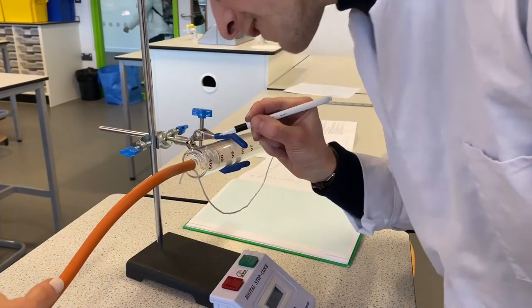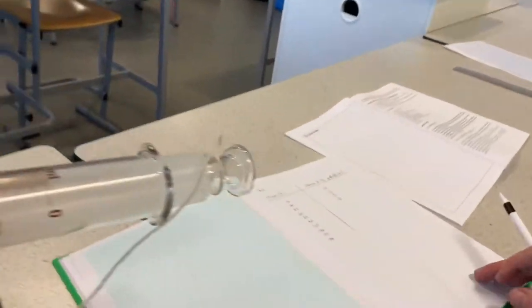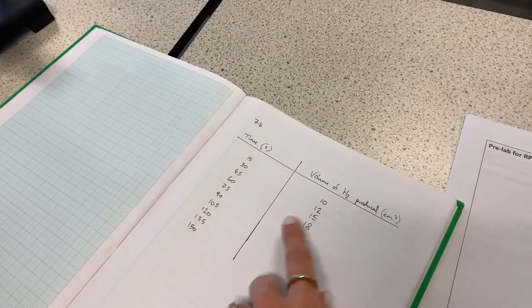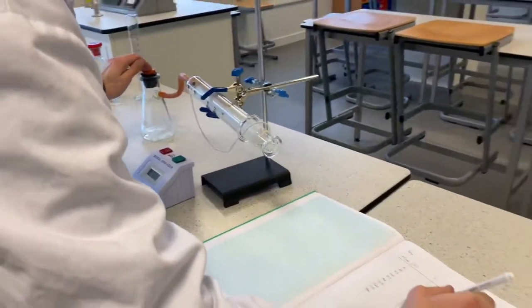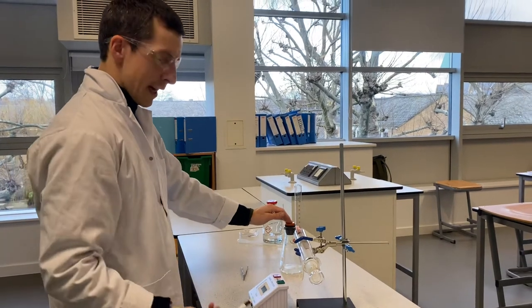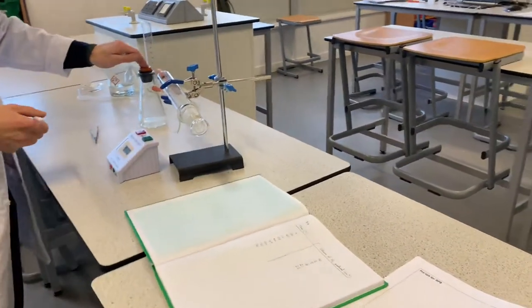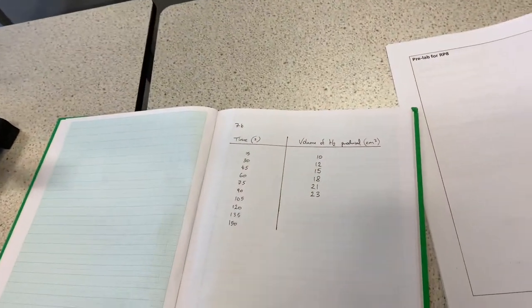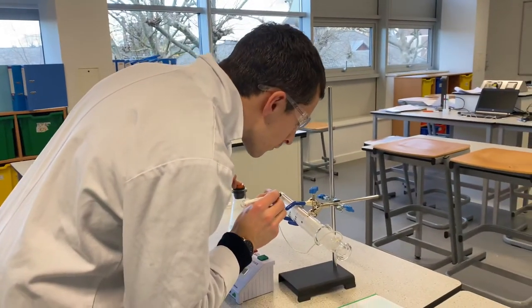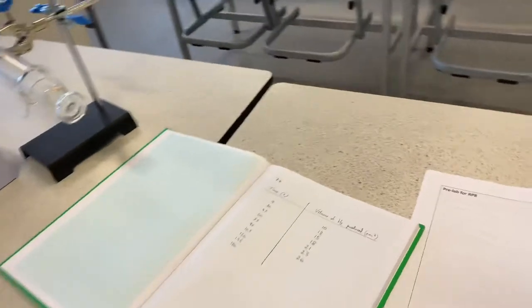Okay, so it's actually working rather well today. Can I take a look at your table? What is this table? So you are showing time in seconds and volume in centimetres cubed — yeah, that's exactly what I'm doing. I'm measuring the volume produced at intervals of 15 seconds, and we're going to go for two and a half minutes, so we're going to go up to 150 seconds. By then it's going to slow down — might even have stopped.